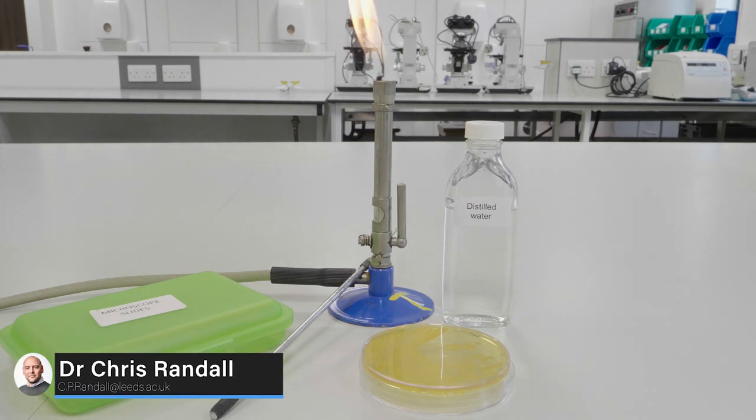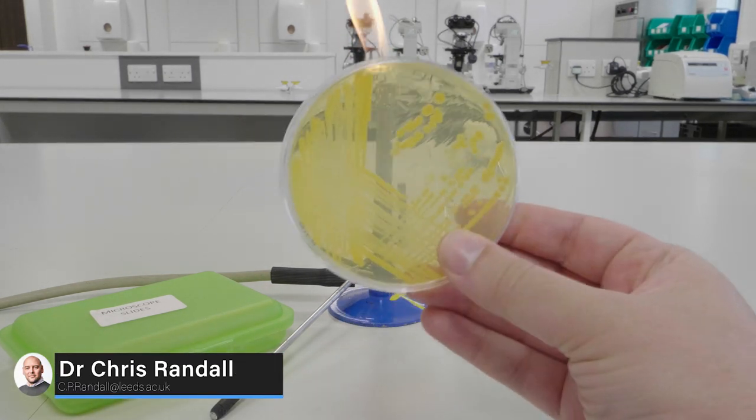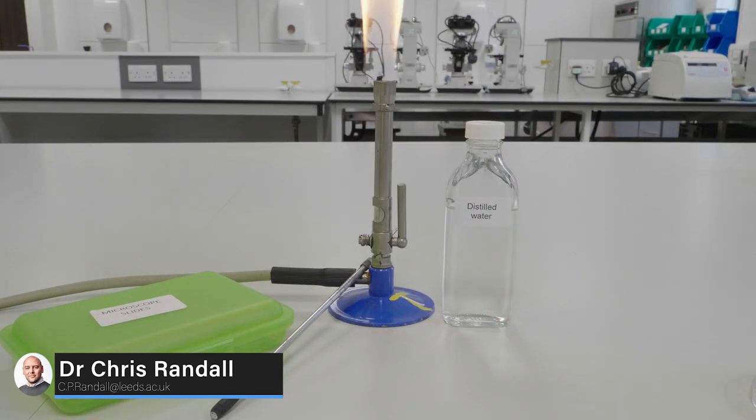In this video we are going to show you how to prepare a heat fixed bacterial film and stain it using Gram's method.